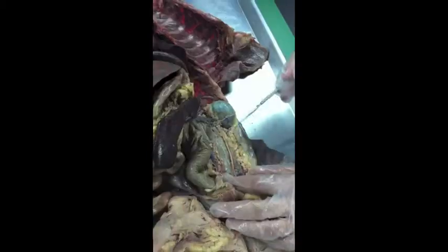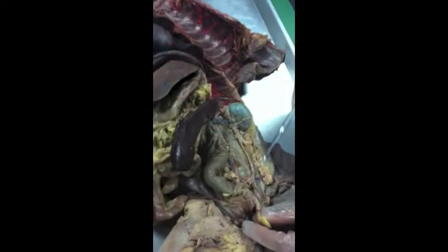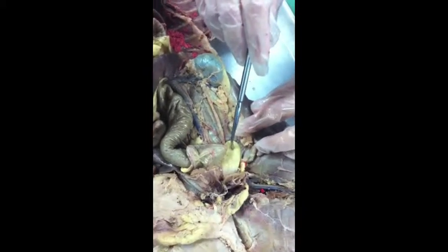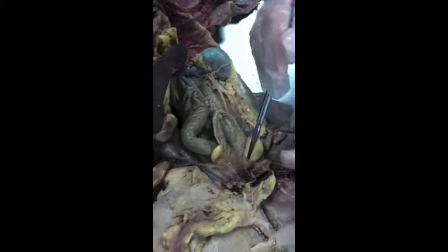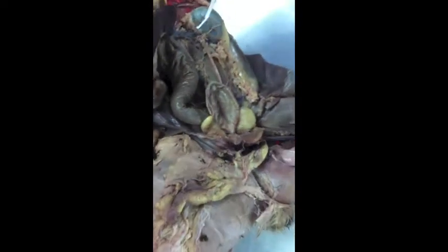Okay, can you point again to the ureter? Urinary bladder. That's this fatty little thing here. No, that's the urinary bladder. All right, let's start out: kidney, ureter, urinary bladder, urethra. Is that this thing? Exits the bladder, right in there.